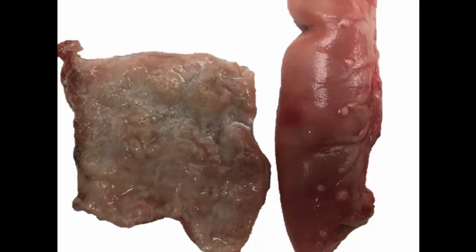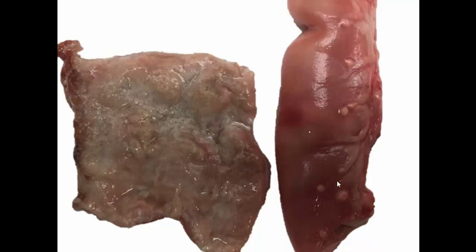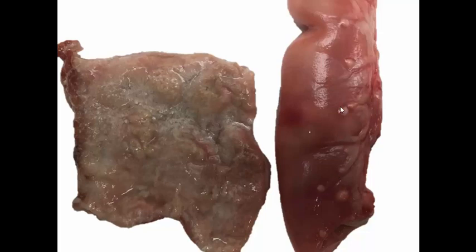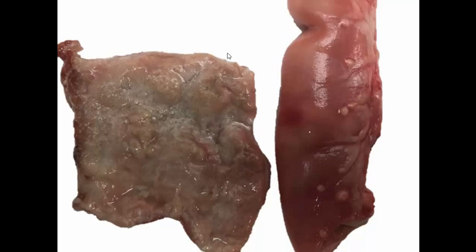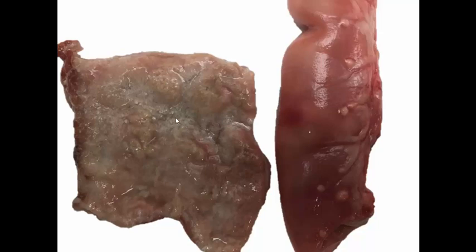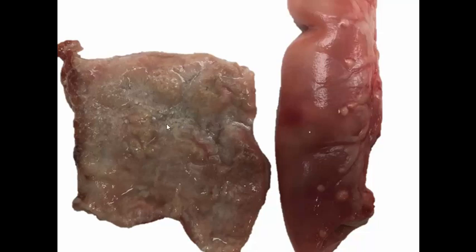What a great picture. This particular person took a picture of not only the inside, which is fairly characteristic, but also the outside of this section of gut so we can see everything that's going on. Let's start with the name of the condition: it is known as lymphangiectasia. It is a disease seen in certain breeds of dogs such as soft-coated Wheaten Terriers, Yorkshire Terriers, and Norwegian Lundehunds, among others. What we're looking at here is the mucosal surface, and these little white patches are villi in which the lacteals are markedly dilated and contain chyle, a high-fat liquid.